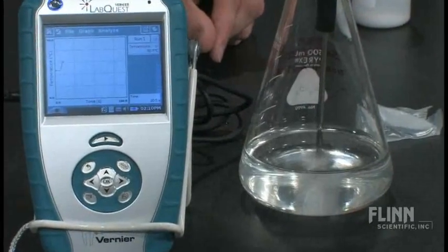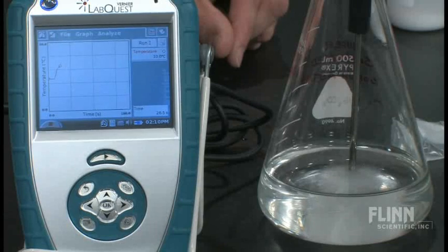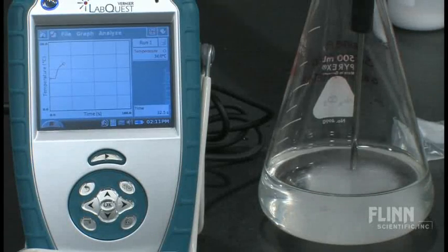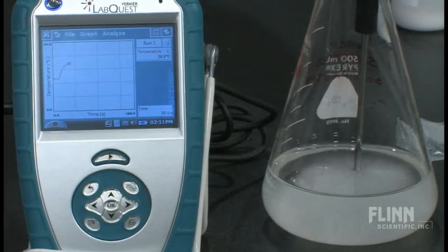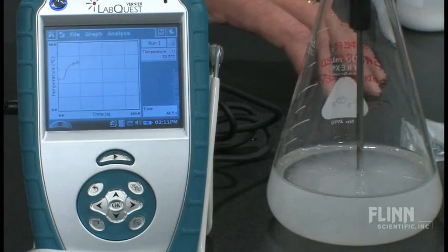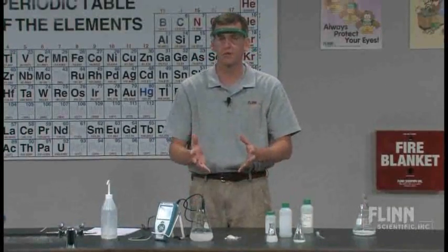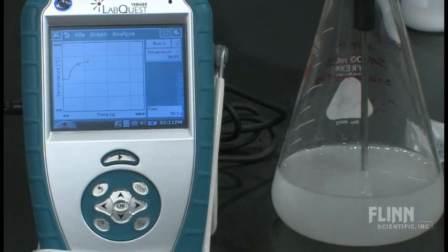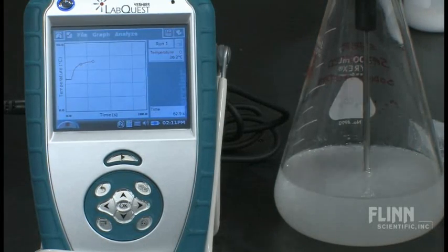Then I'm going to take that seed crystal into our supersaturated sodium acetate. And the kids just love watching those crystals grow on top of that. You can tell about the nature of your saturated solution — you saw how quickly the one went before as we put the seed crystal in. Sometimes when you make them they might still be a little warm as they go. And what's happening to the temperature on that? You can see that it's increasing. Again, a discrepant event. When they've seen things turn solid before and they've felt them, it felt cold to them because they're thinking about ice. It looks like ice. And so we have to go beyond what they see, change a little bit of the misconceptions, and say: that's exothermic.